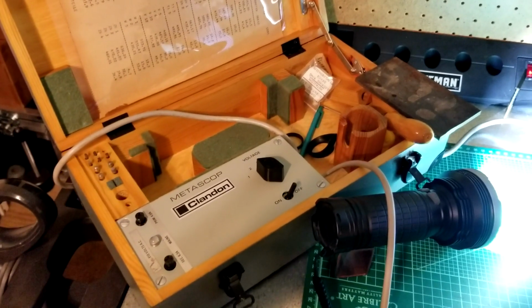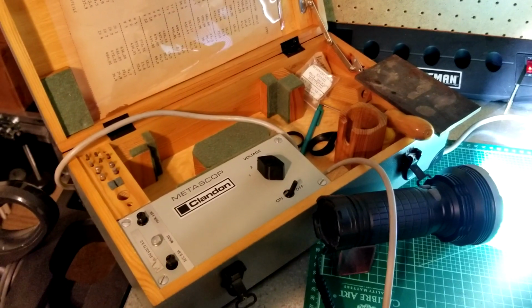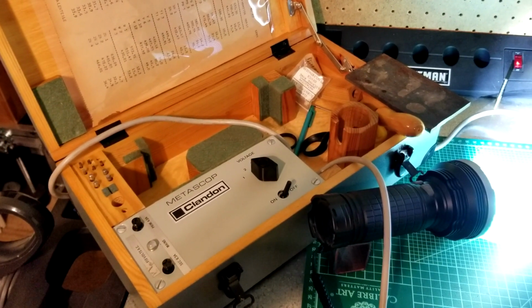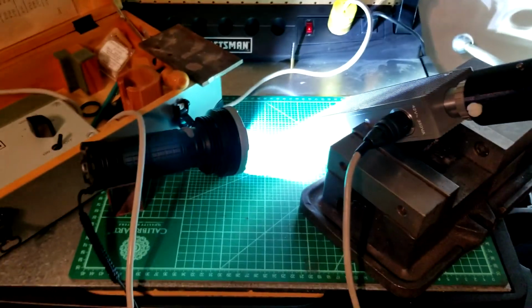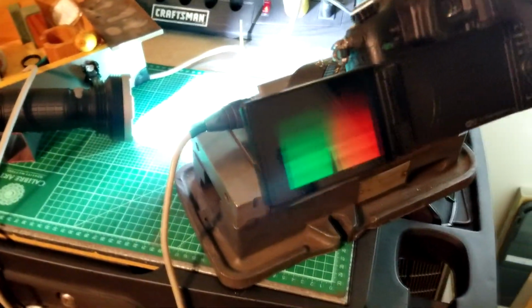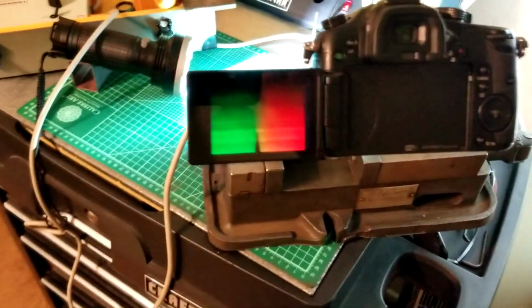So here's my Metascope configuration that I'm trying to get working, even though I don't understand it. I understand the function of it and what it's supposed to be doing.